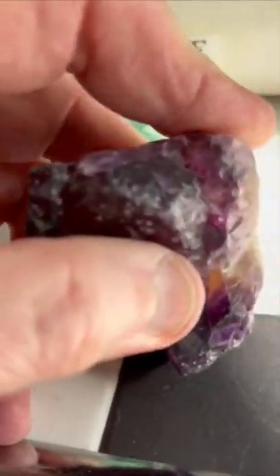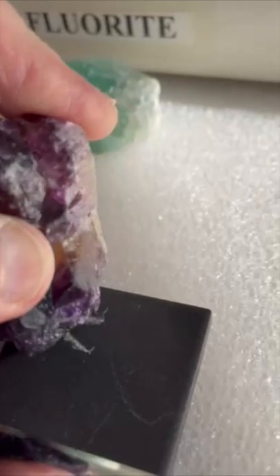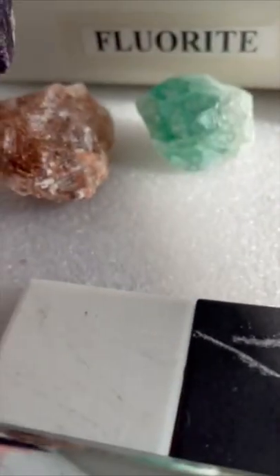The mineral fluorite, a compound of the elements calcium and fluorine, naturally occurs in all colors of the spectrum.